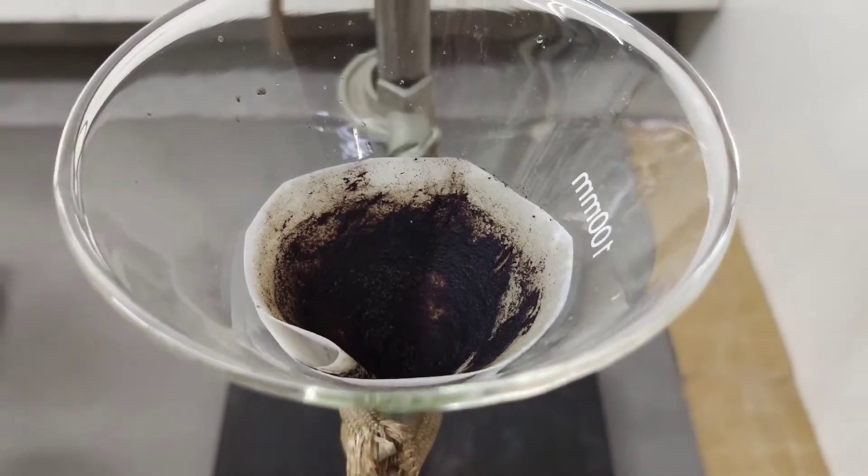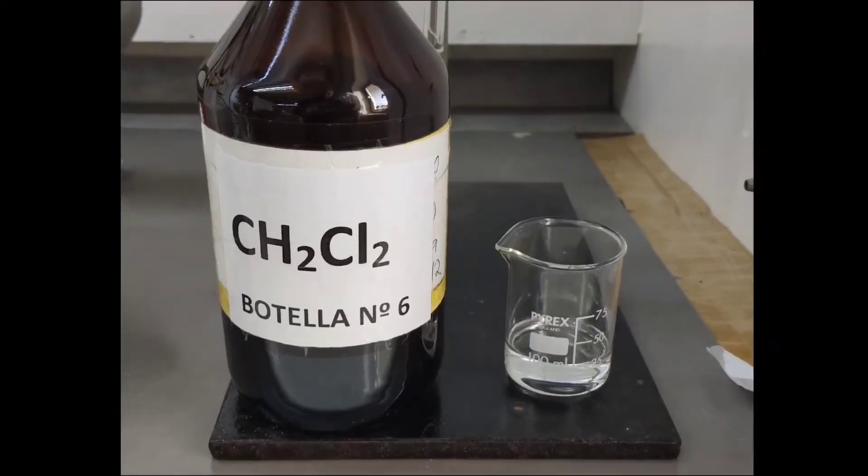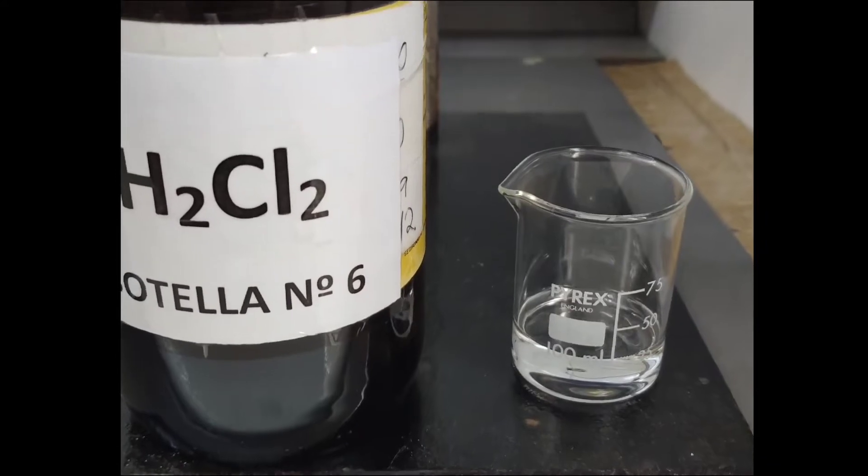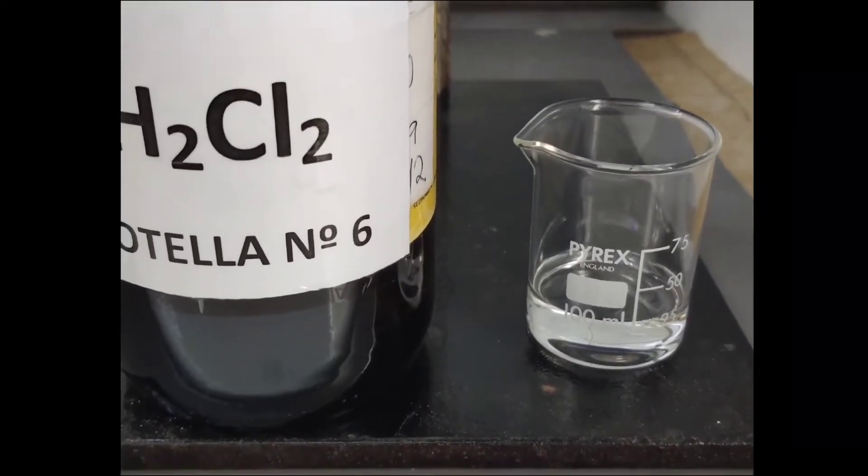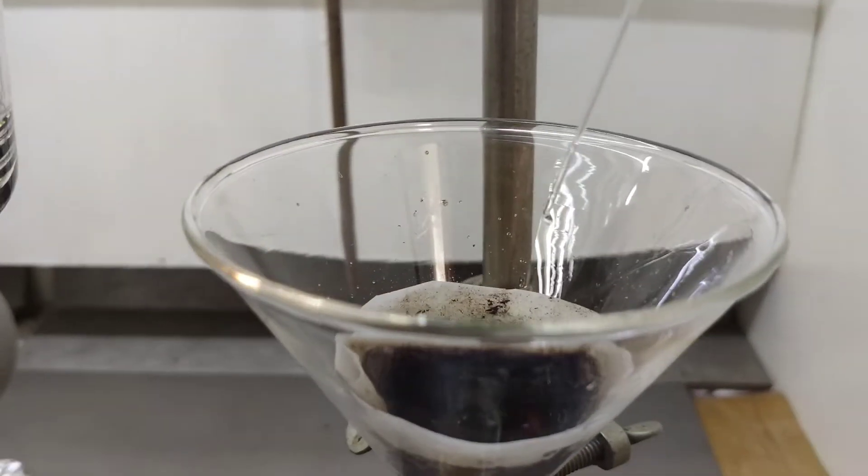This is the precipitate that we are going to now dissolve with dichloromethane, DCM, helping ourselves with a little bit of methanol.